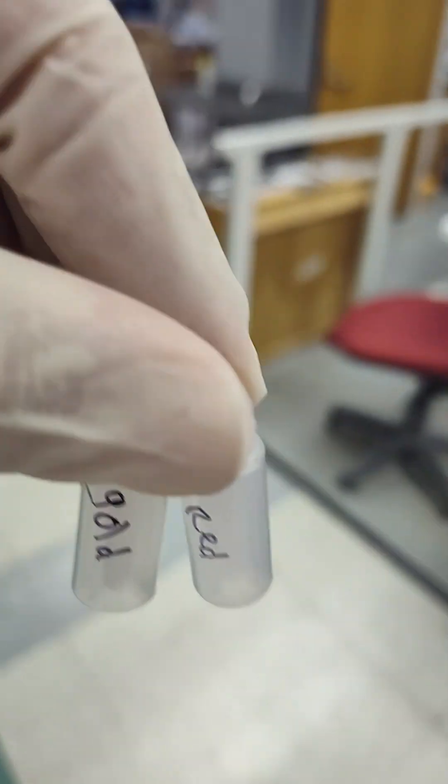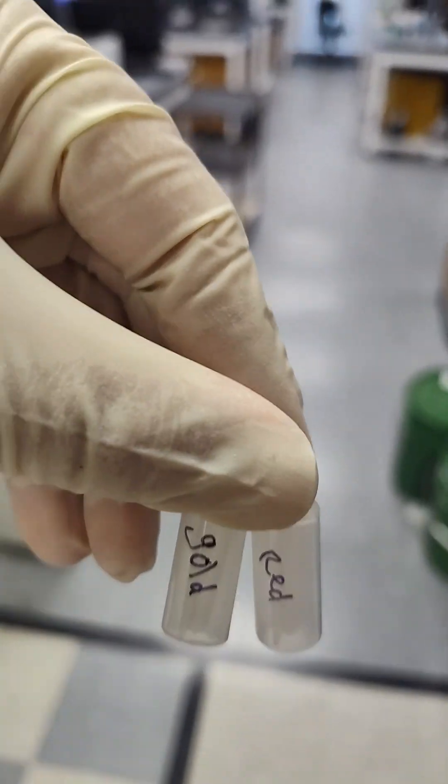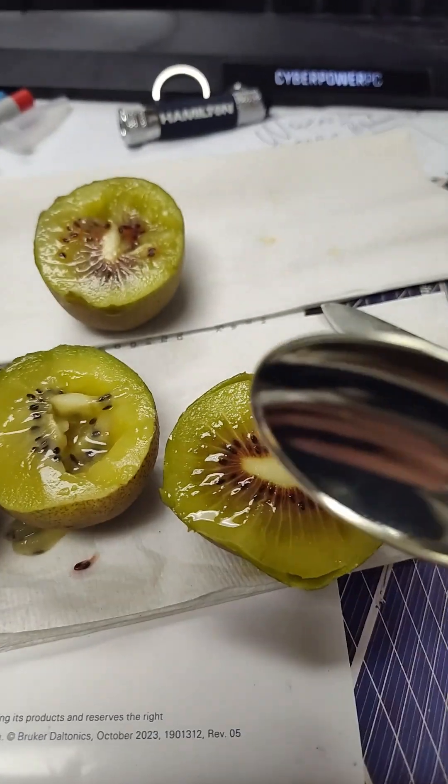We're putting this on the low res single quad first because it has the extended wavelength PDA detector. So we know which peak is the red peak. There's absolutely no point in wasting the rest of it. Especially that red one. It's so good. Cheers. What is this like? It's like sweetened chard so good.